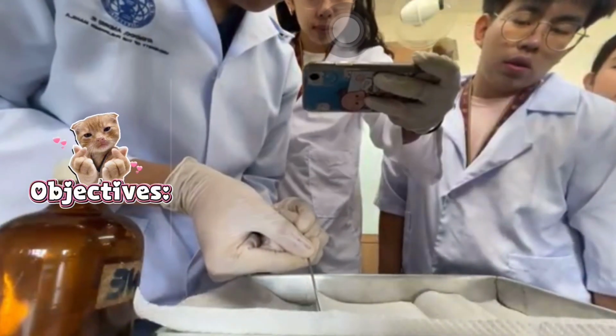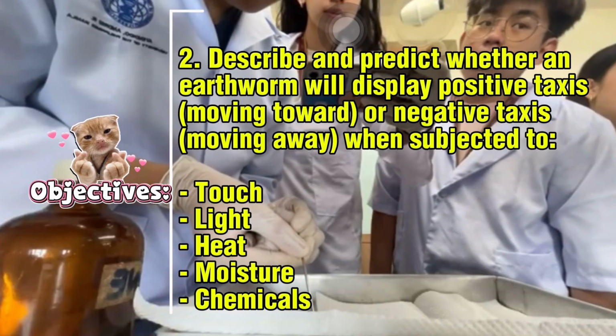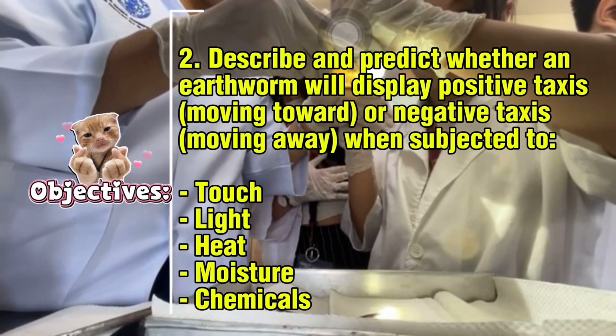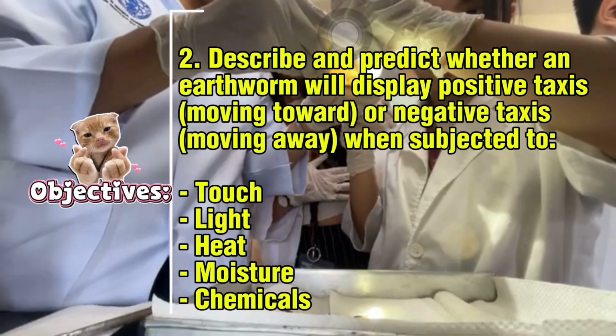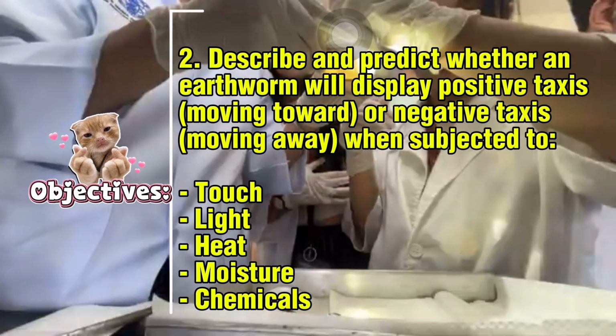to external stimuli. Second, describe and predict whether an earthworm will display positive taxis or negative taxis when subjected to touch, light, heat, moisture, and chemicals.